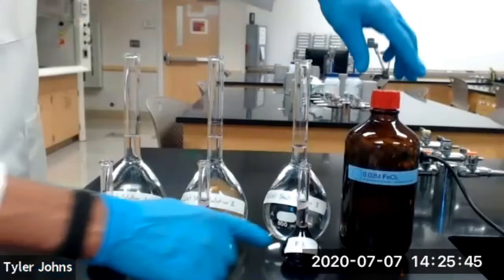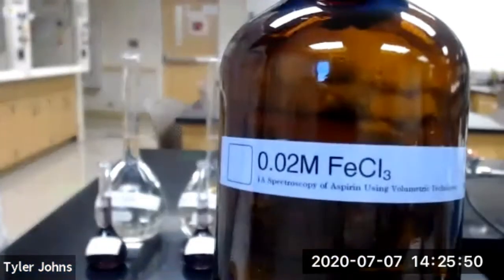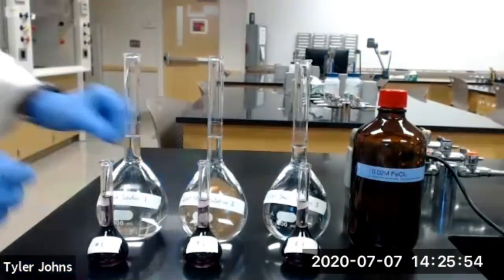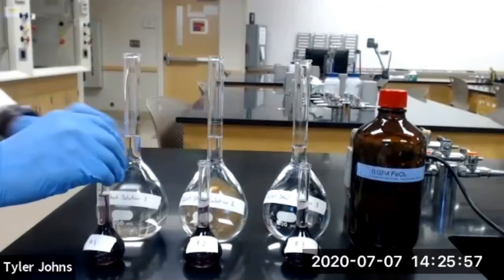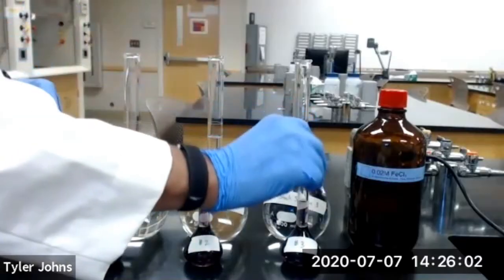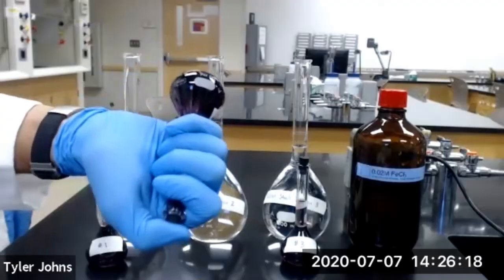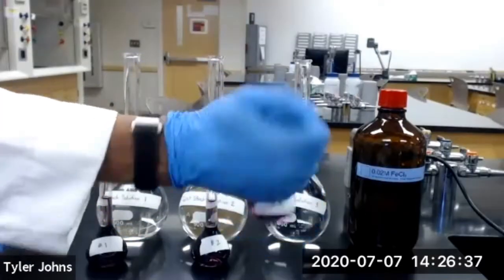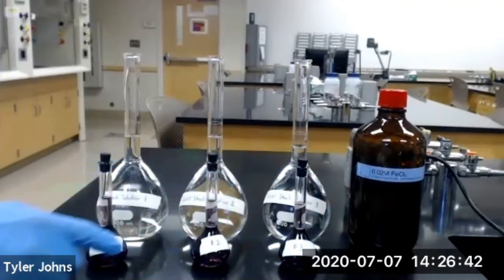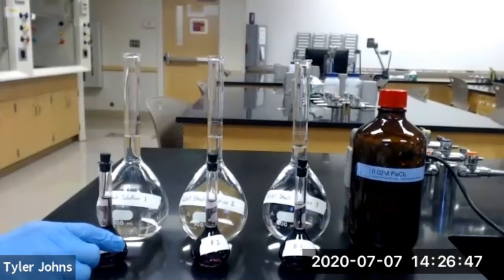After filling our 50 milliliter volumetric flask to the line with our 0.02 molar iron chloride solution, we will now stopper each of the 50 milliliter volumetric flasks and invert to mix. After mixing, our samples are now ready for analysis in the spectrophotometer.